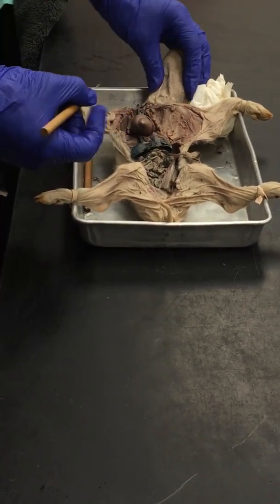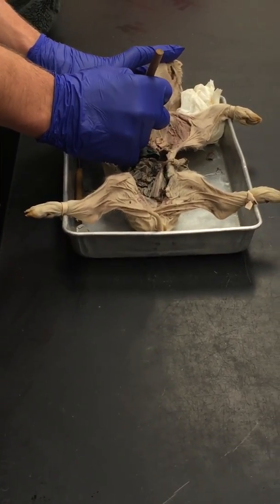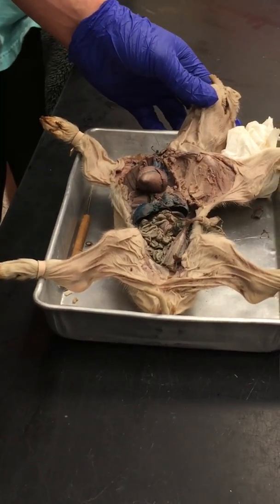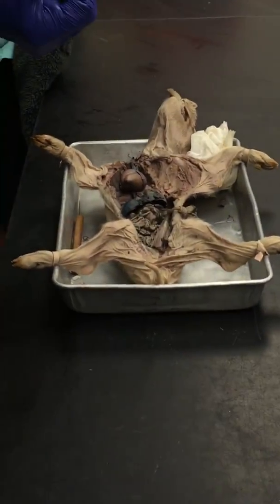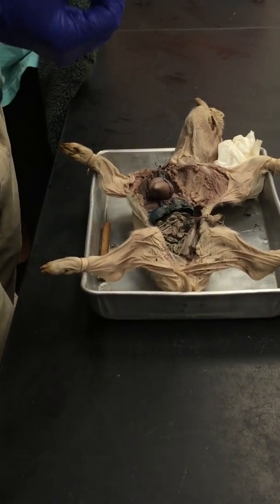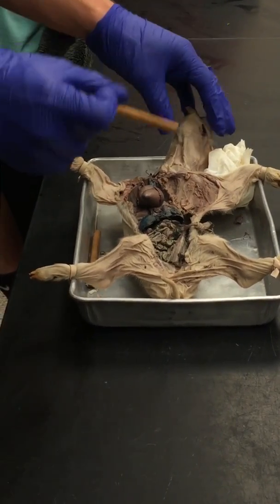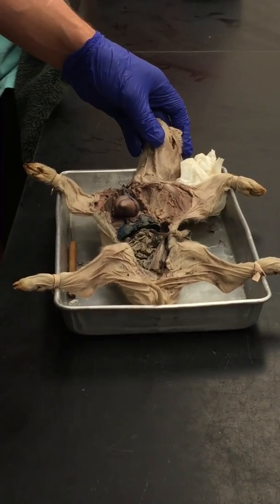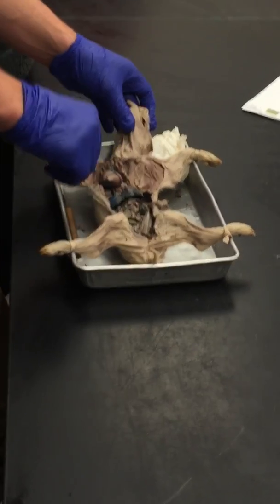So this is where it's called the ductus arteriosus, which is this little bitty thing right here. It will shunt the blood from the pulmonary trunk into the aorta. Once the fetal pig breathes in its first breath of air, the ductus arteriosus will then kind of shrivel up and turn into the ligamentum arteriosum. So that's why that was in the last lab. The ligamentum arteriosum is because that used to be our ductus arteriosus, and that is basically the shunt from the pulmonary trunk to the aorta.